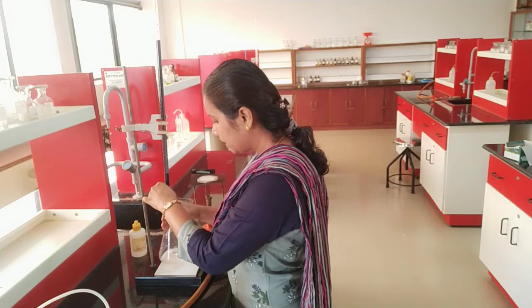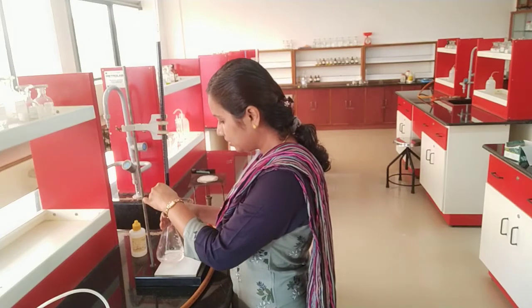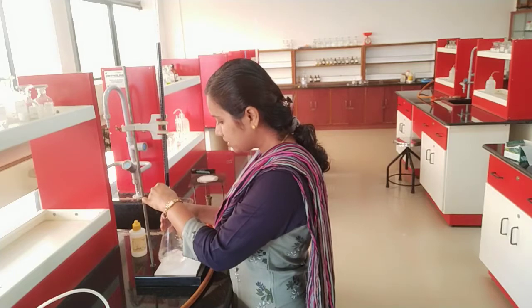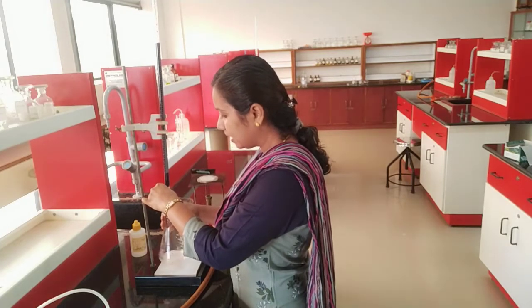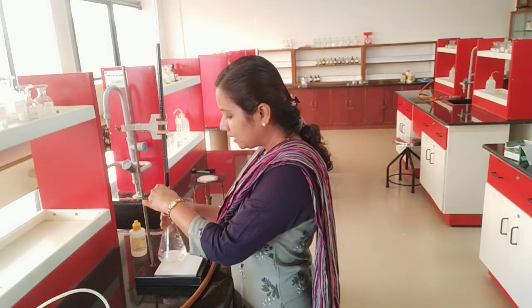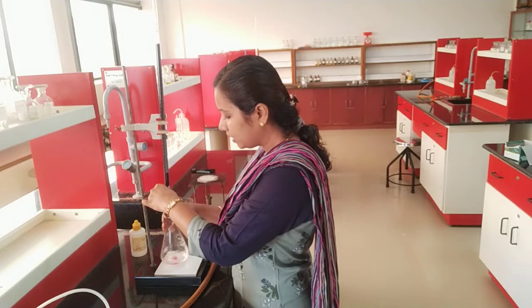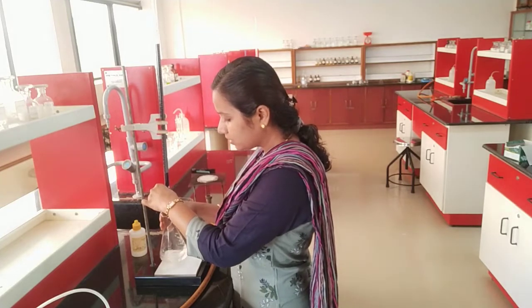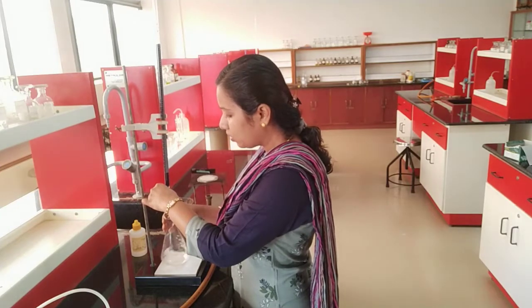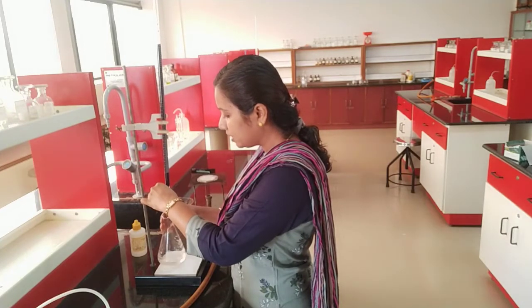So I am proceeding with my experiment and my initial reading was 15. I have started my titration. The left hand should be opening the burette and the right hand should be mixing the contents of the conical flask. This experiment does not require any heating, while the first experiment — oxalic acid and sulfuric acid — should be heated, so that it acts as an autocatalyst and the carbon dioxide produced will be expelled out. So this is experiment 2 under volumetric titration.